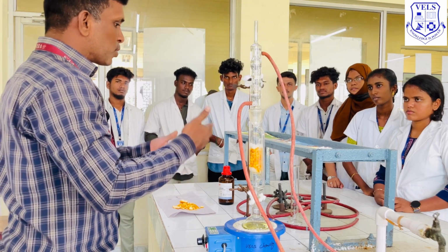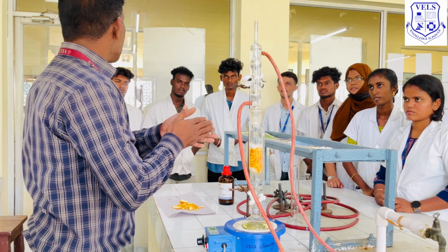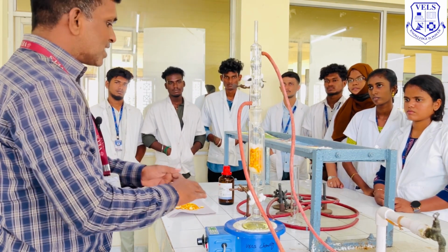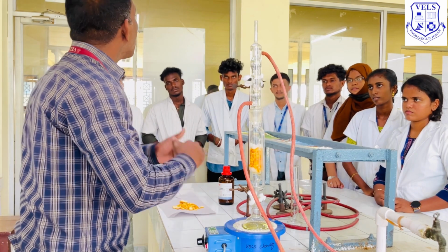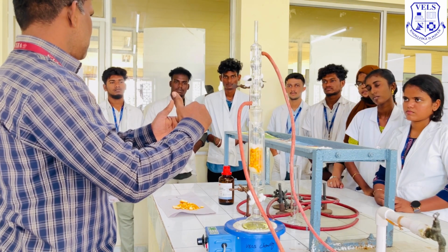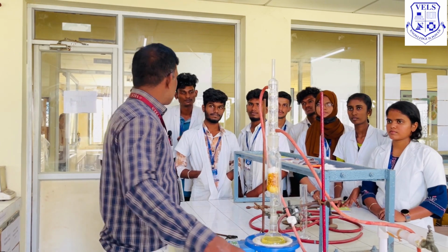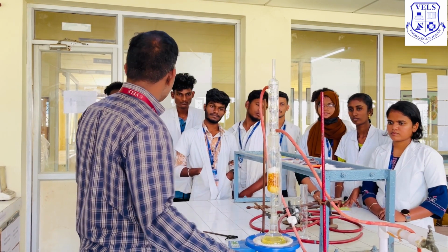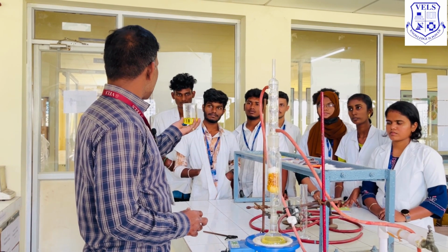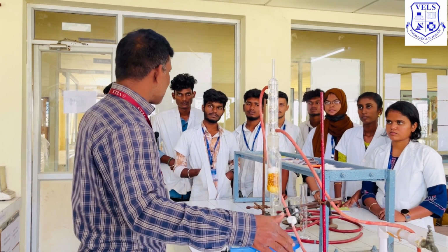In this process, the oil and the non-polar compounds present in the orange peel will come out. That's why we are using the non-polar solvent hexane. So this is the first step. After 1 hour of distillation of hexane, we got this hexane extract, and we will keep this separately. Afterwards we will recover the hexane solvent.